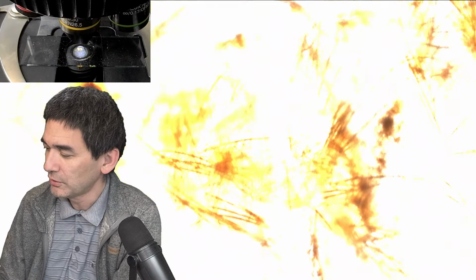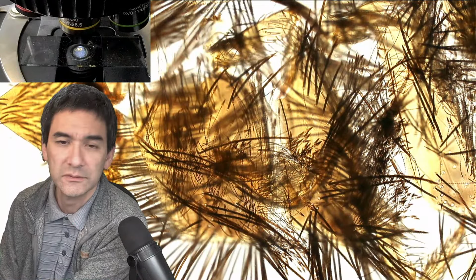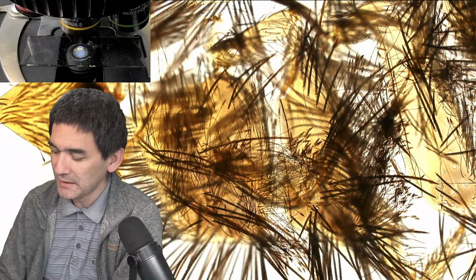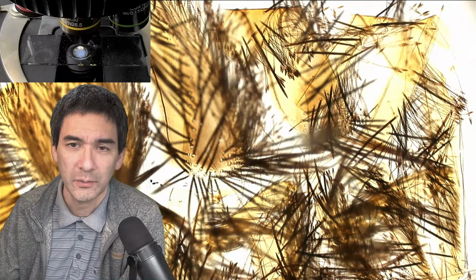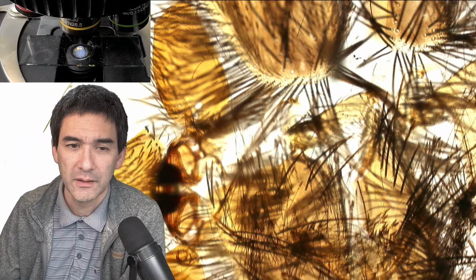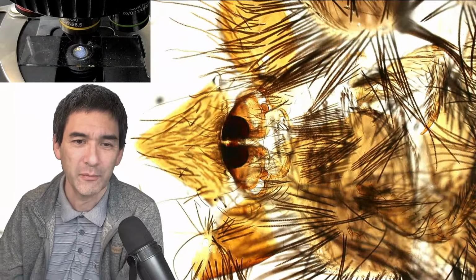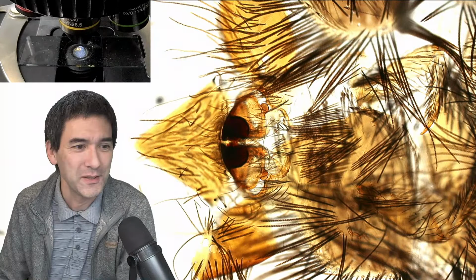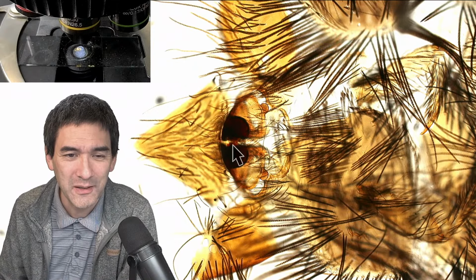I'm going to go bright field here, and it started to clear up even more. And this is how it looks. So that's basically the exoskeleton of the carpet beetle larva, and lots of hair. And when I looked at this, what I think those two dark dots are, correct me if I'm wrong, they look like the mandibles, the mouth parts. I just discovered this today. Those things here look a little bit like the mouth parts of the carpet beetle.